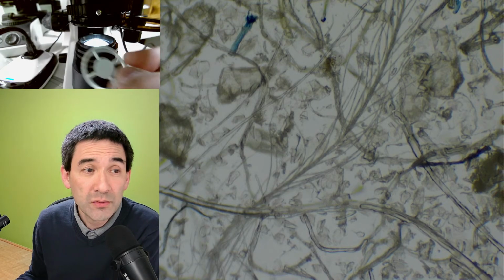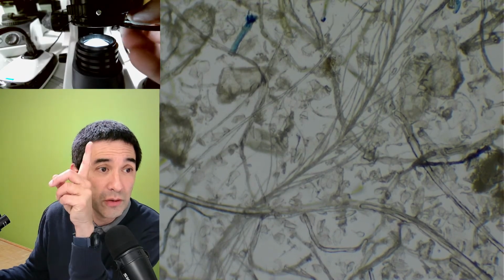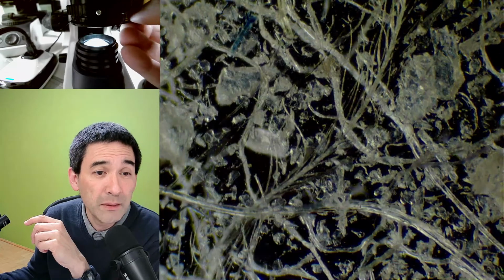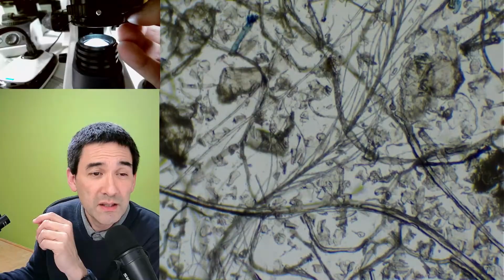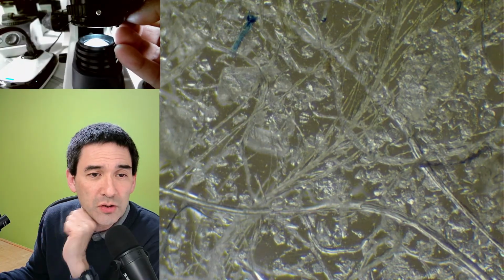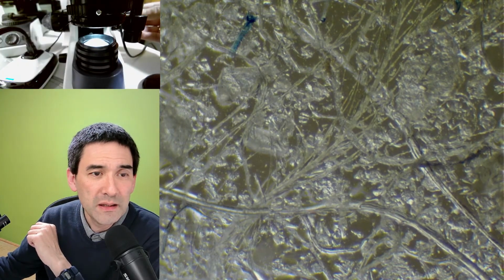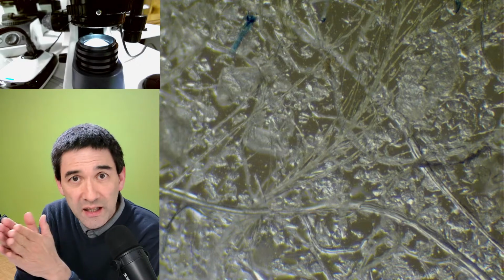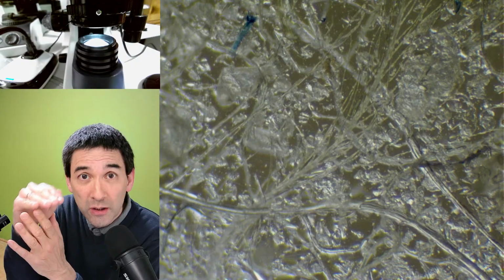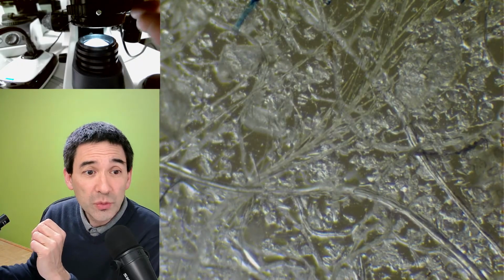And you see, you put this into the filter holder here on the top, right? And when I put it into the light path and start moving it in a little bit like this, then we actually see that the dust over here looks a little bit like light is shining from the side, right? And this casts a shadow, and this gives it somewhat of a three-dimensional impression, right?